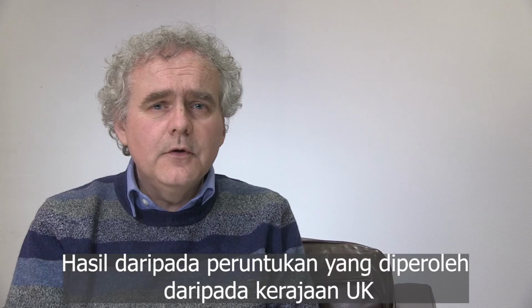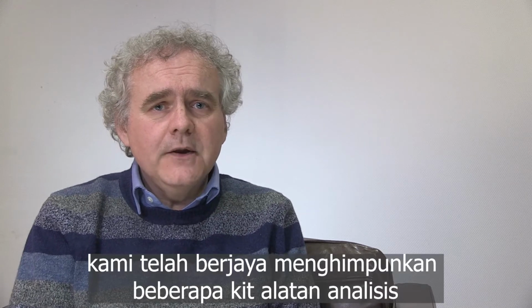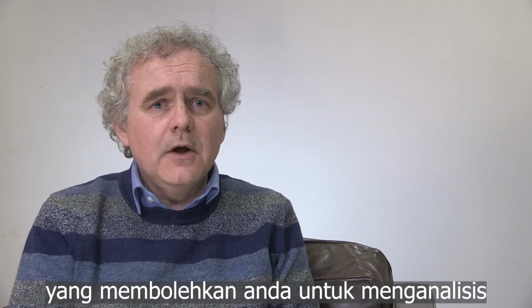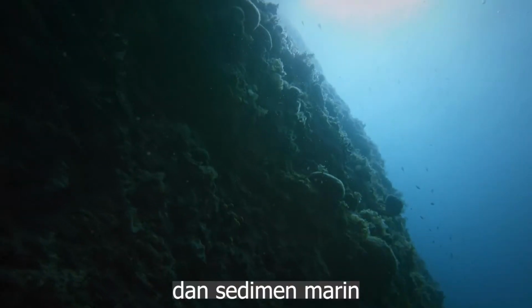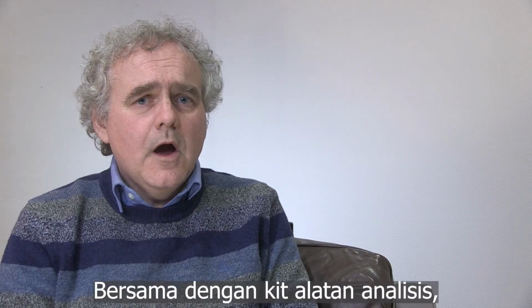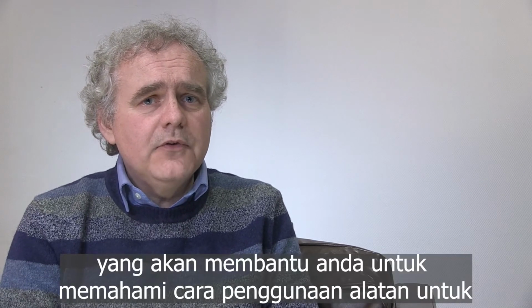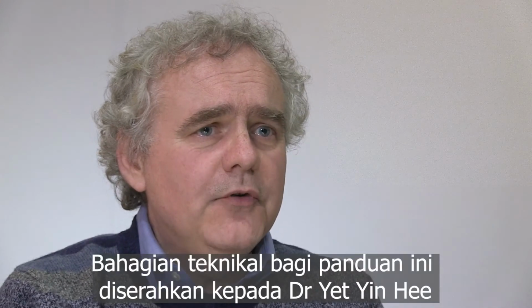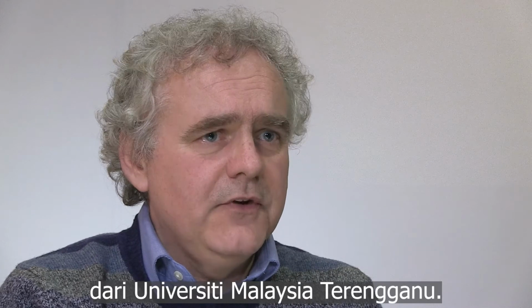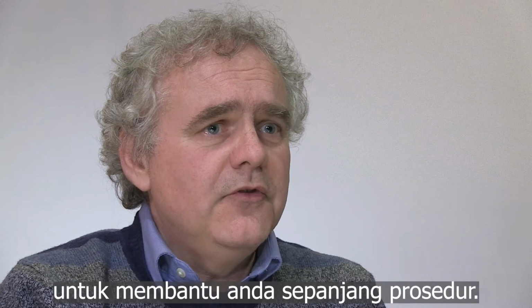Thanks to funding through the UK government in a Global Research Translation Award, we've been able to assemble some analytical toolkits to allow you to analyse microplastics in all kinds of different samples, from fresh water to marine sediments and even domestic products. Along with the analytical toolkits, we've also developed this video guide, which will help you to understand how to use the equipment effectively to measure the microplastics in your samples. The technical sections of this guide are presented by Dr. Yet Yin He from University Malaysia, Terengganu. I'll hand you over to her now in the Microplastics Research Lab to take you through the procedure.